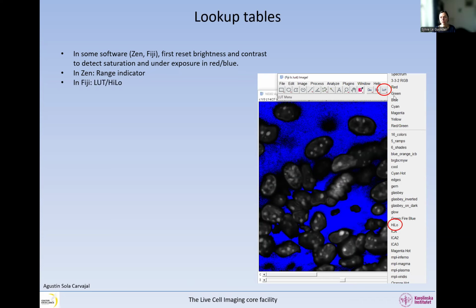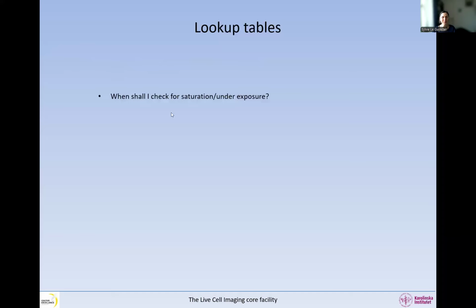So if you go there to Fiji, lookup tables, you have your image, you can apply the HiLo lookup tables, and then this is what it will look like. And now this image is not acquired in a proper way because we have lots of blue in the background. And in Leica, it's called LUT. And I don't know in Olympus. So if someone has an Olympus microscope, please let me know.